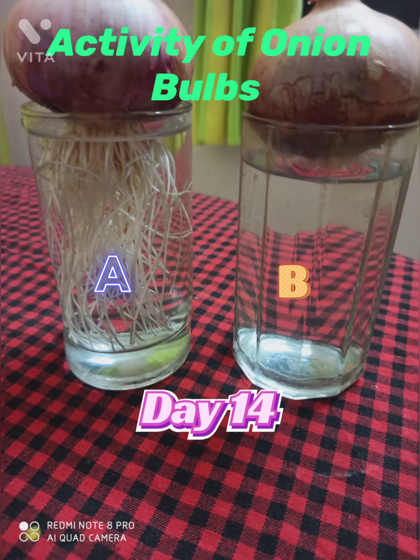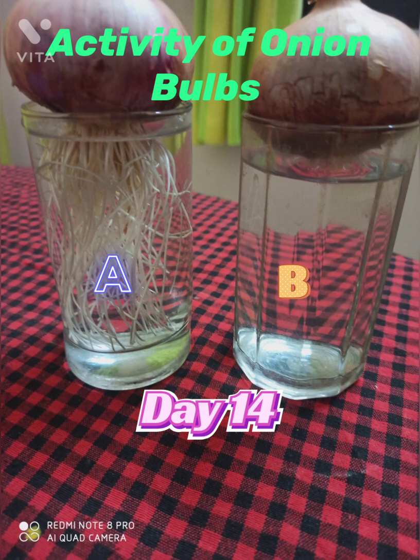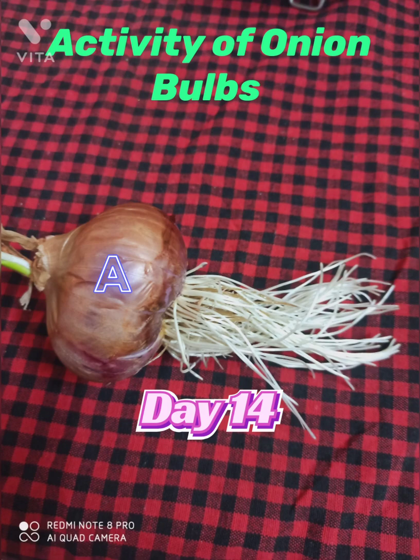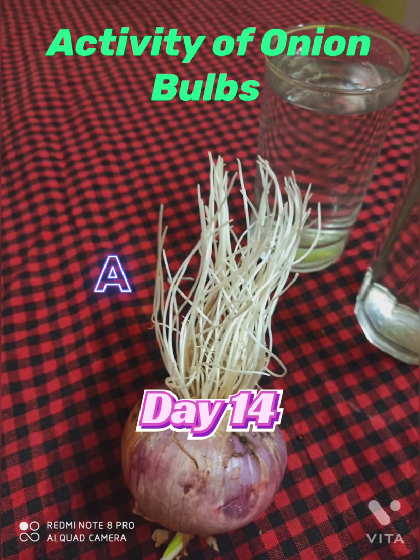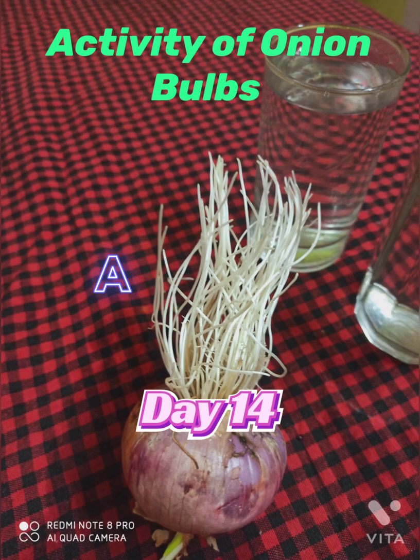Now let's move on to day 14, which is the last day of our activity. As you can see, the roots in beaker A have almost touched the bottom of the glass tumbler, whereas beaker B is showing no growth. I have taken out the onion bulb from beaker A again — see how much it has grown compared to the start. The beaker A onion bulb has grown enormously, whereas there was no growth in beaker B because the root tip was cut.